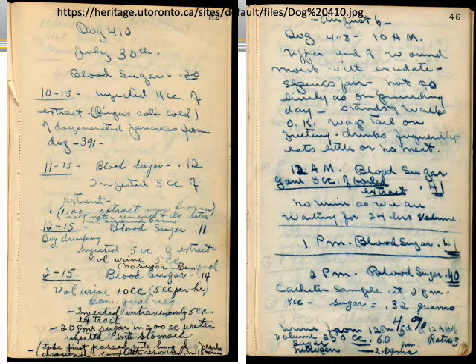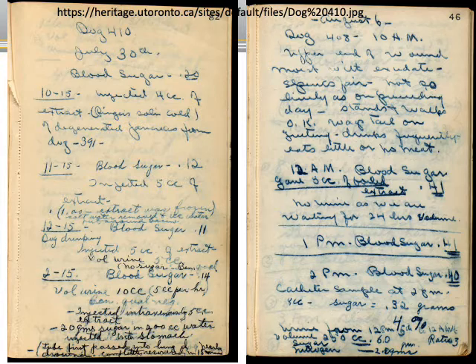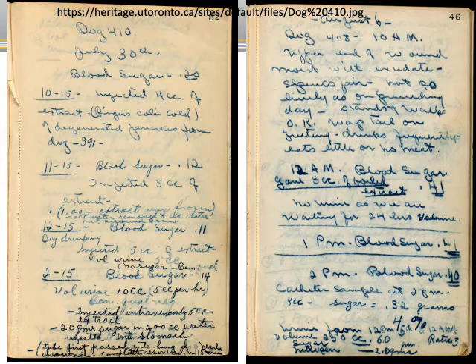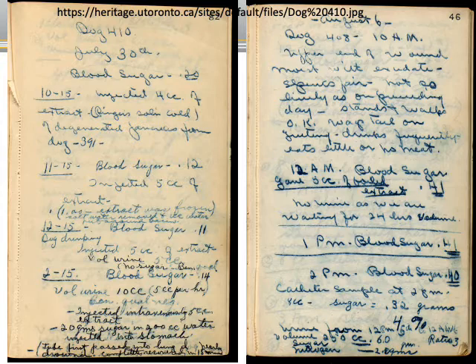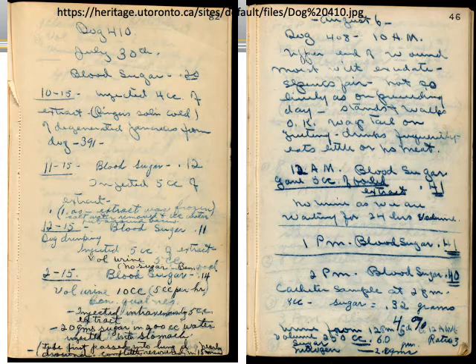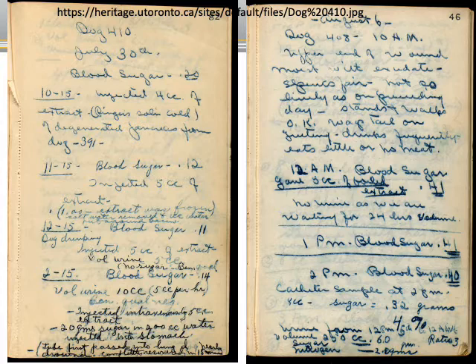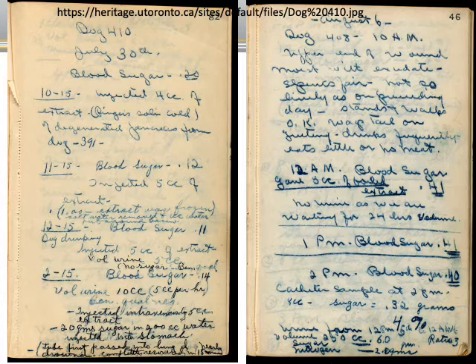Let's take a look at an example of a couple of pages from a lab notebook. Can you guess who owns these? Note the experiments that were being done, narrated in detail. These are notebooks you can find at the University of Toronto Library — experiments we are very proud of. Almost a hundred years ago, Banting and Best saved the world with the discovery of insulin. You can see that a hundred years later we can still read that notebook.